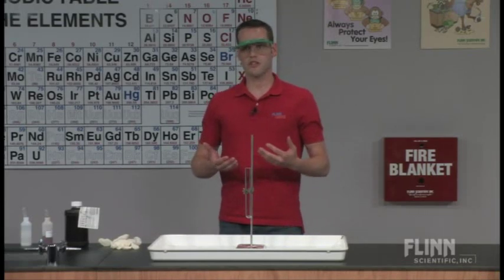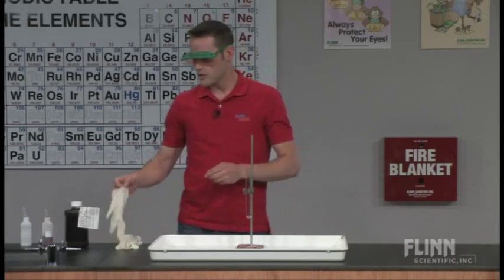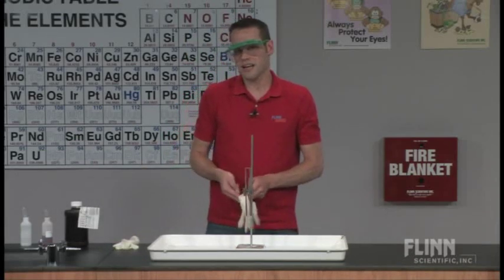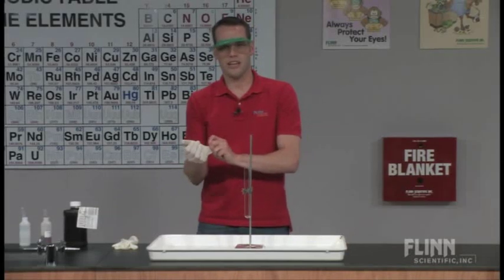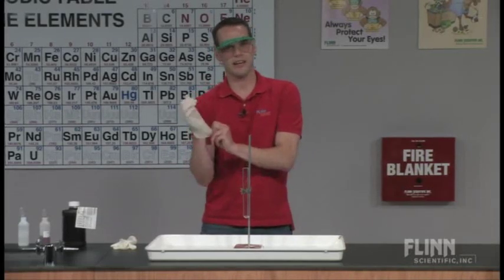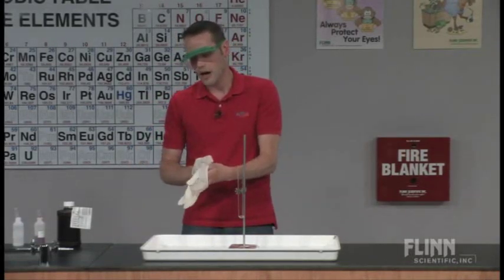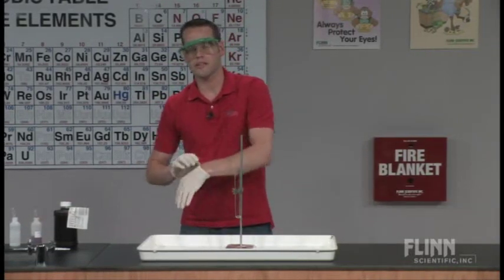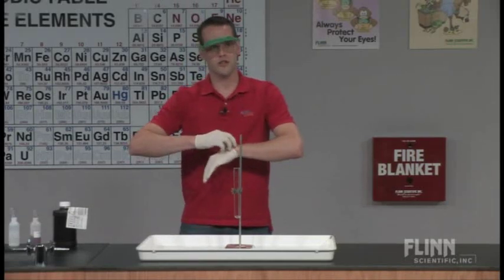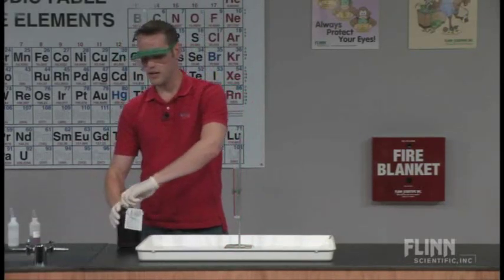For this demonstration, I will be using 30% hydrogen peroxide, so it's very important that if you're using a peroxide concentration this high that you protect your hands. If you ever spill it on your hand, it turns it to a very bright white color, almost looks frostbitten. What's happening is you literally just oxidized your skin at that point. So do make sure that you protect yourself and put gloves on.